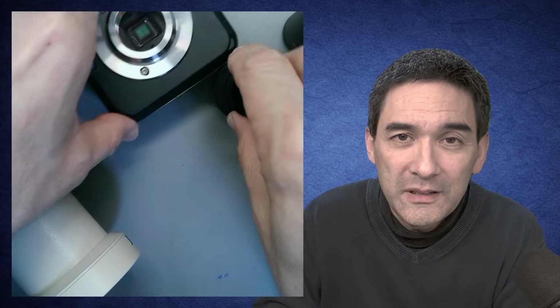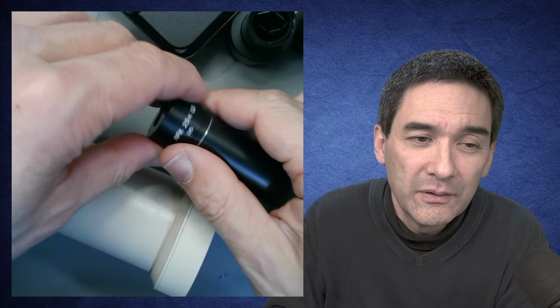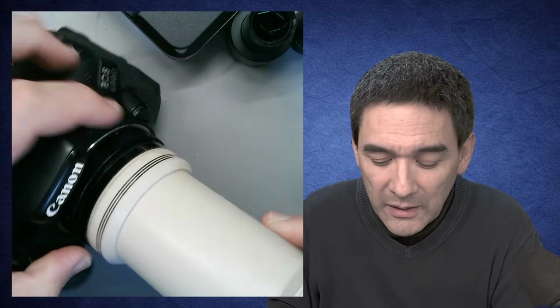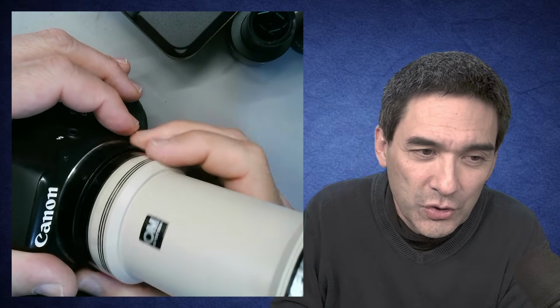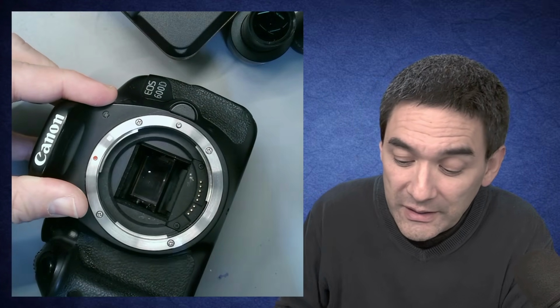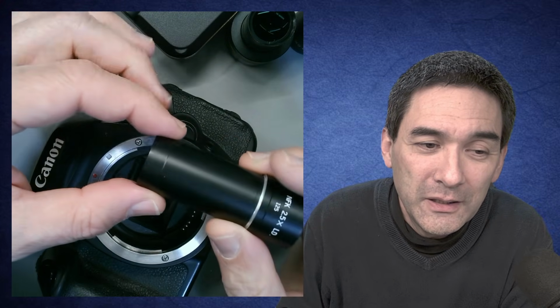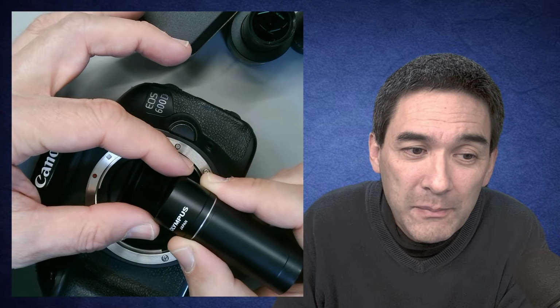Now, what about the DSLR camera over here? I've already taken out the optics, 2.5 times. Now let's look at the size of the sensor in here. Actually, we won't be able to see the sensor because the mirror covers it. I just want to show this to you: the sensor is hidden behind the mirror, but it doesn't matter. You can already see it's significantly larger than the diameter of the barrel over here. This basically means that if you want to fit the image from the microscope on the sensor, you have to actually make it larger.